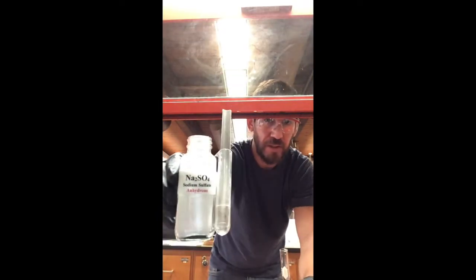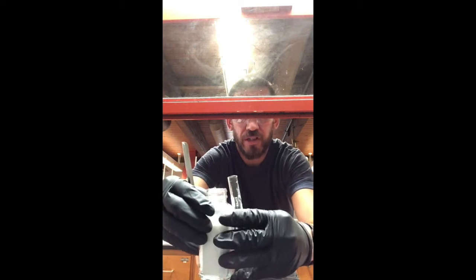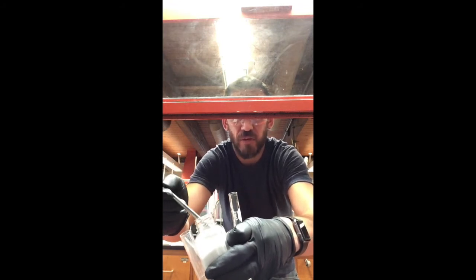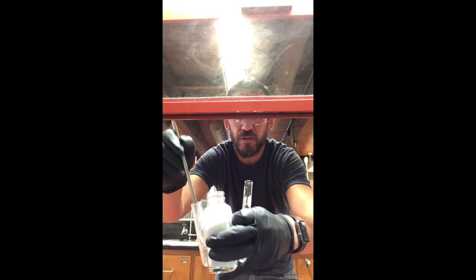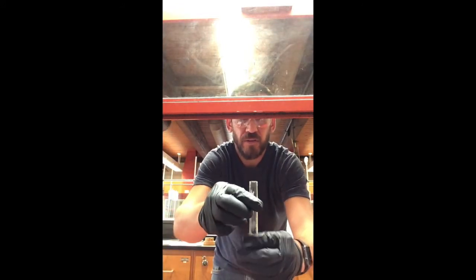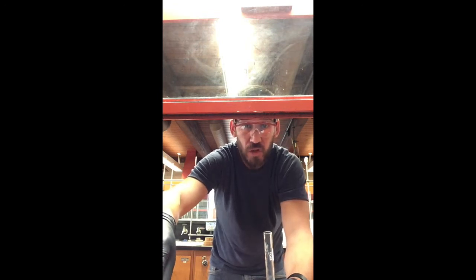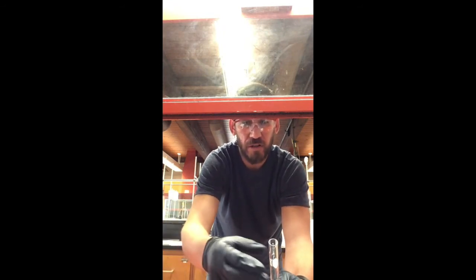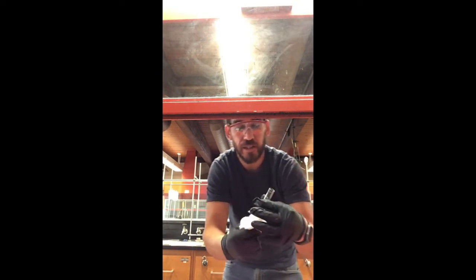Methylene chloride needs to be dried with sodium sulfate. In this experiment you can use other drying agents but we'll use sodium sulfate — just the tip of a spatula, a very small amount, since this is much less methylene chloride than the 6 mL we dried before. Also notice on the wall of the tube that the methylene chloride dried and left what we presume is benzoic acid — make sure you try to get that when transferring, because leaving material behind will ruin your distribution coefficient calculations.